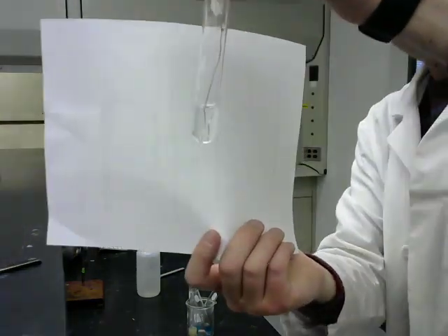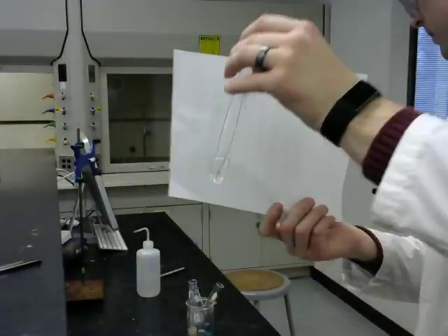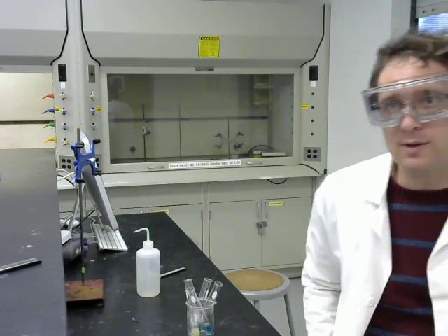And the copper and zinc sulfate still seems to be not doing anything. Okay, hopefully you can compare those reaction outcomes to your predictions and do the rest of the lab. Good luck.